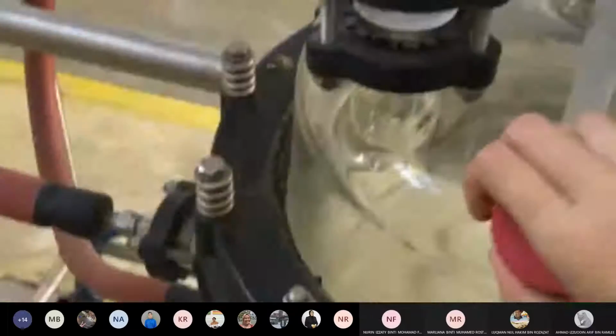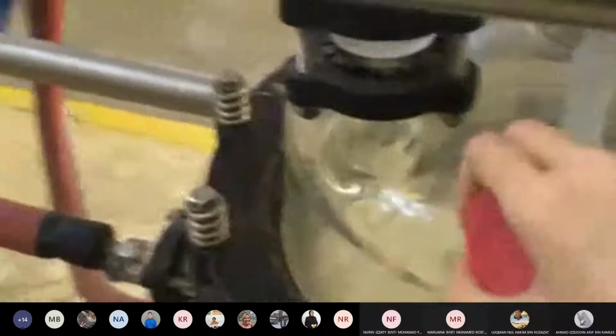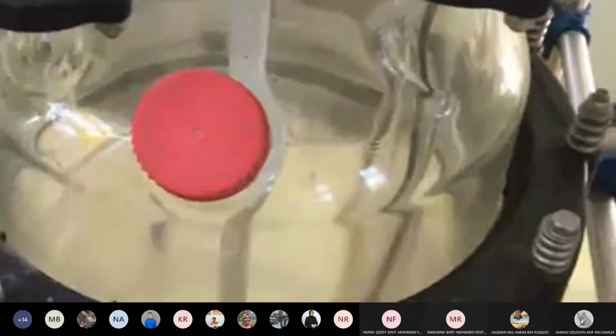Imagine, I already placed the chemical in, because for every reactor I have placed in the chemical so that you can really see how it flows. So I put in the reactor, so by right 6 liters. Oh, we dropped it. Okay, hold on. This is really a live demo. So you place in, you close. So this is the main characteristic of a batch reactor. It is a closed system. It is already closed, you do not disturb the system during the reaction. Nothing goes in, nothing goes out.